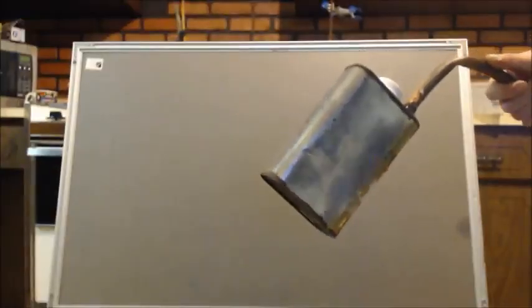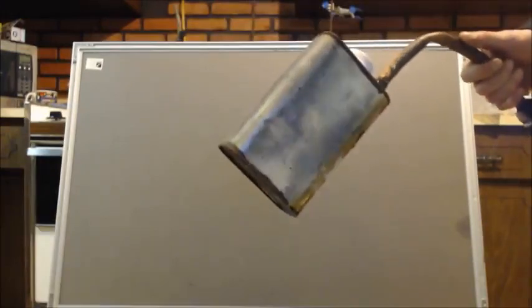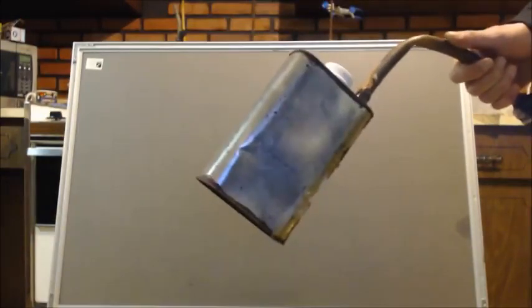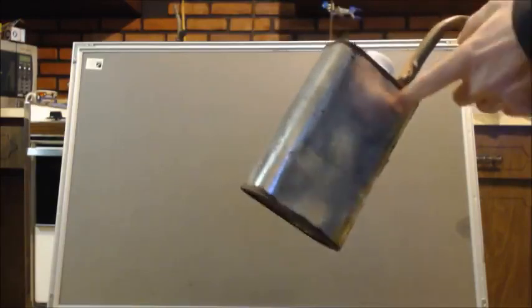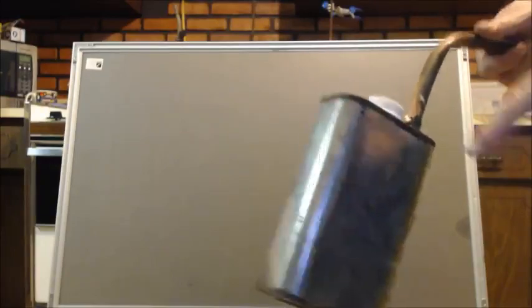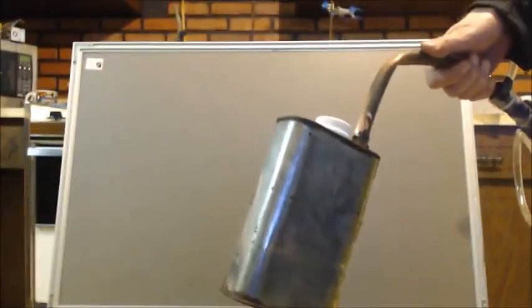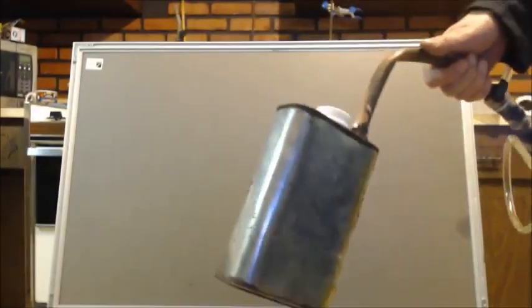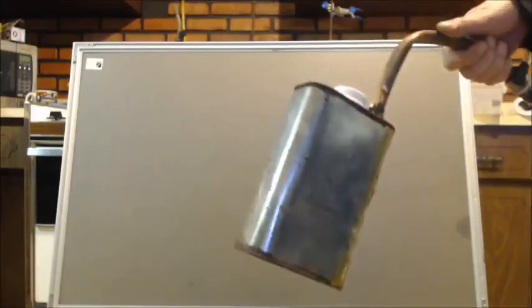Look, I want you to realize something. Even if YouTube didn't say anything about putting disclaimers on, I would still put this in the video. This is a tin can. It's an old rusty tin can. It's got seams on the top, seams on the bottom. It can get a leak, you know what I mean? I just tapped it with a utility blade and it put a hole in it.